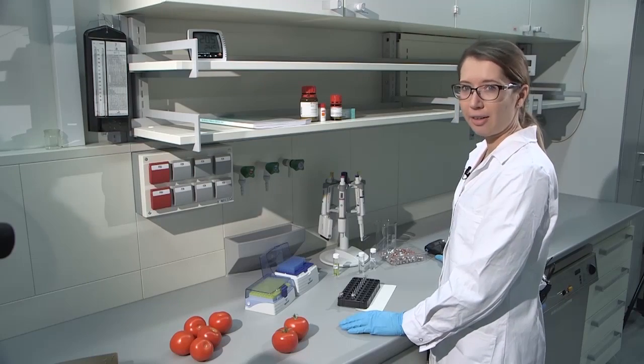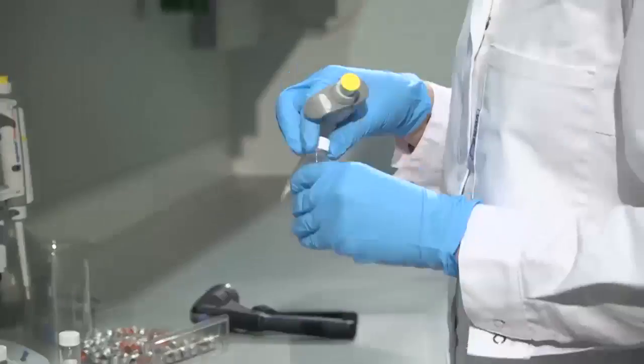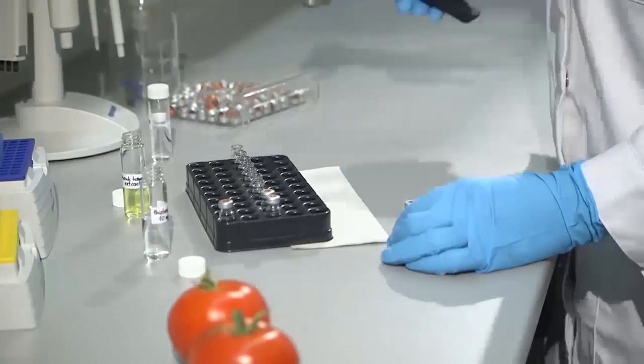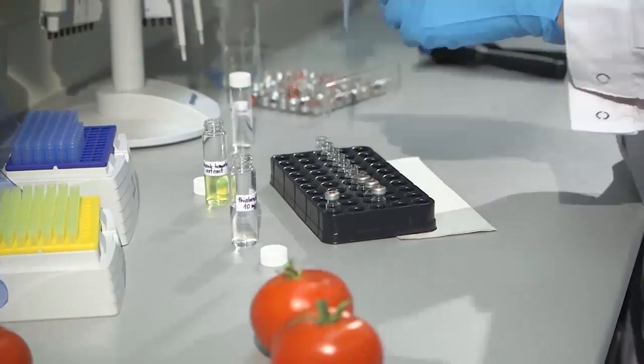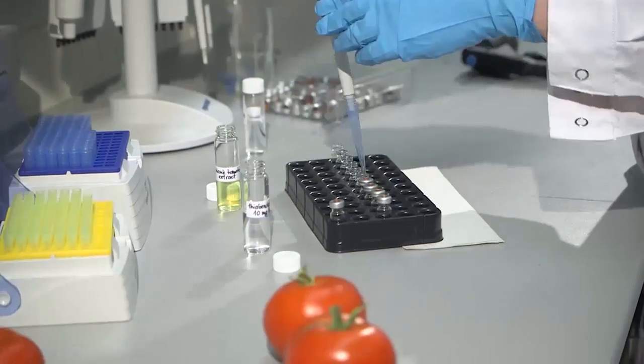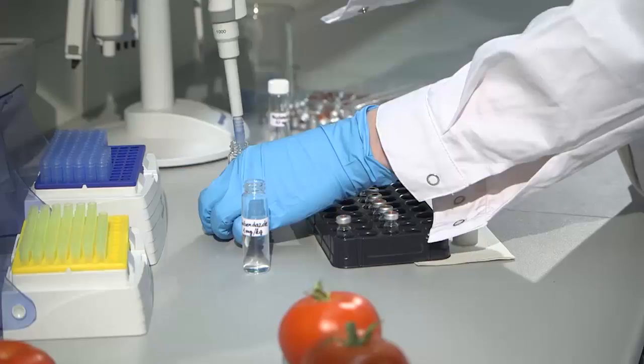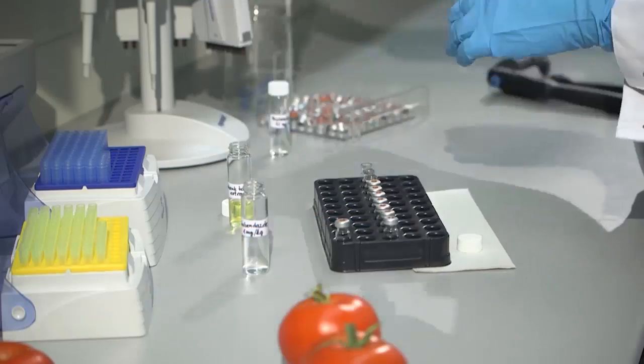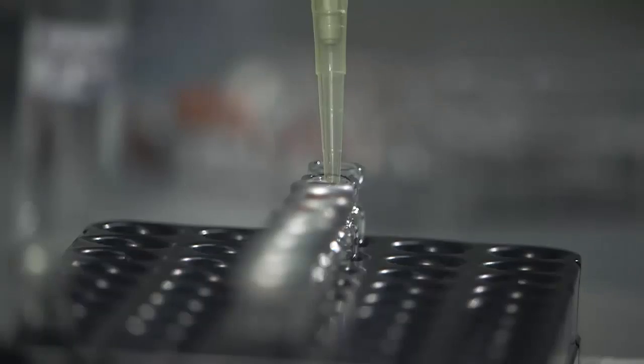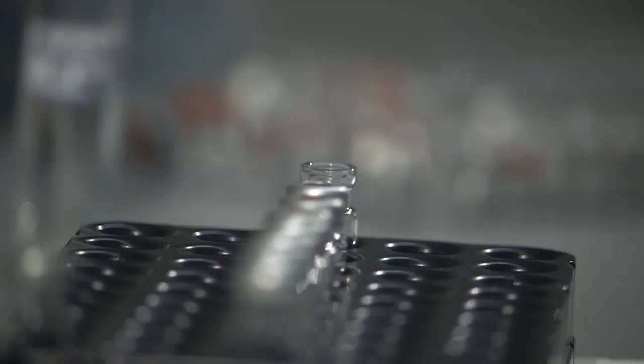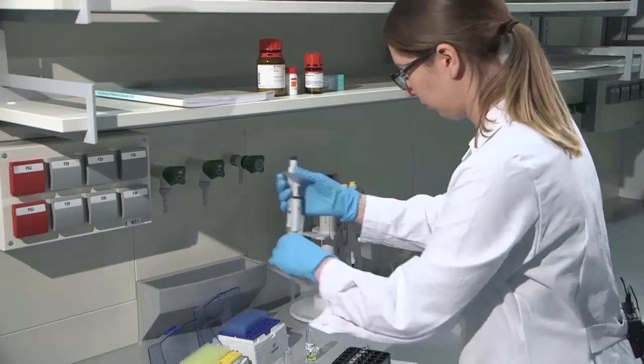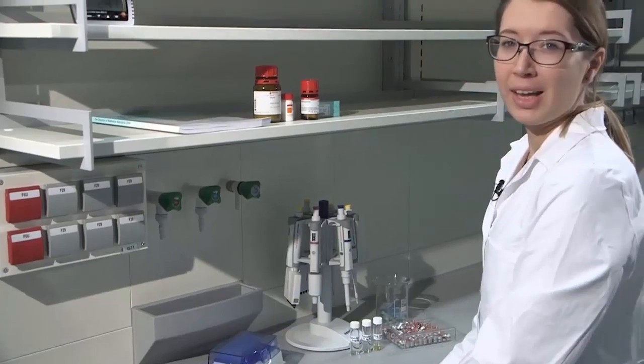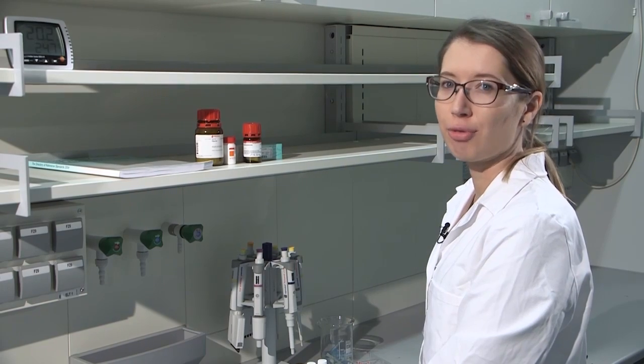And I will continue this with the other 9 samples. And now the matrix match calibration samples are ready to be analyzed.